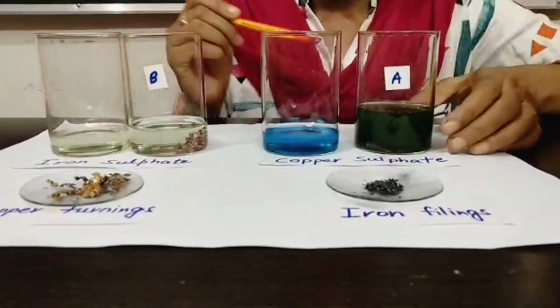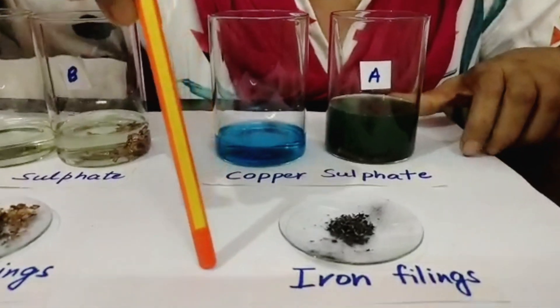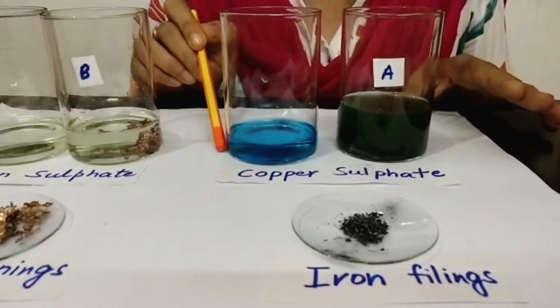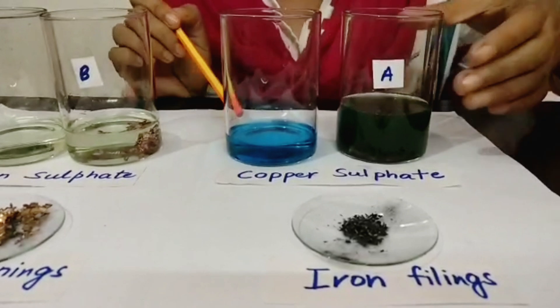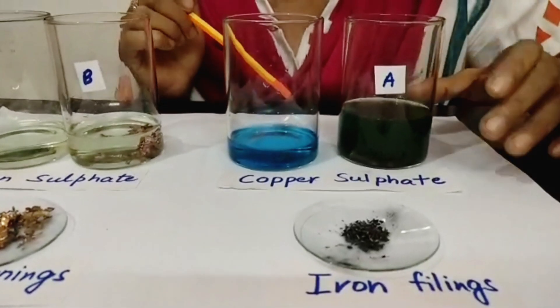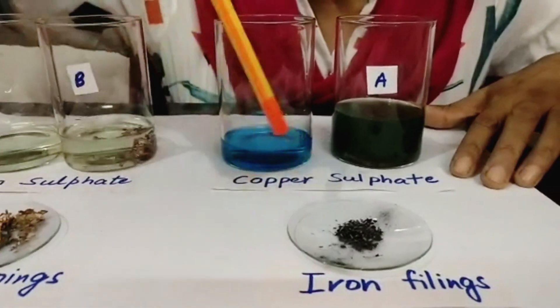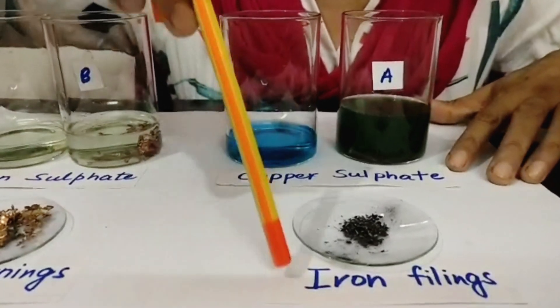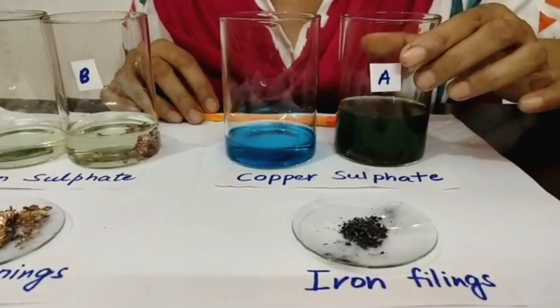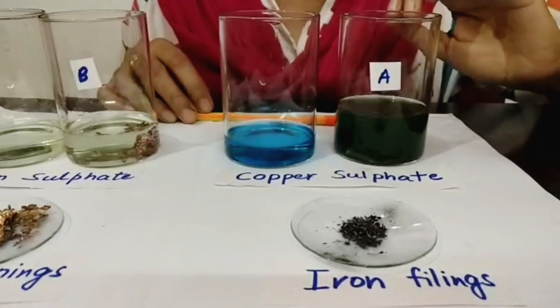But when we see the results of the reaction between copper sulphate and iron fillings, we took the solution in two beakers. You can see that one is still blue because it is still copper sulphate. But here we added iron fillings, and that is why the iron replaced the position of the copper and formed iron sulphate. So this is greenish in colour due to the formation of the green coloured solution, iron sulphate.